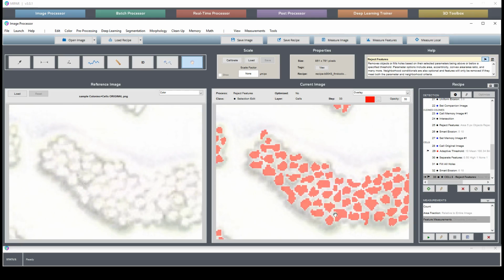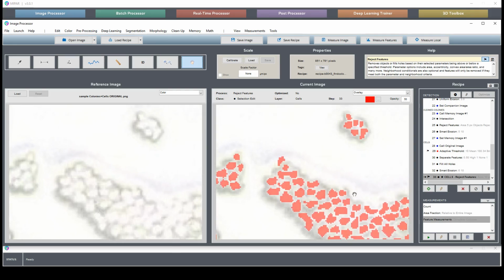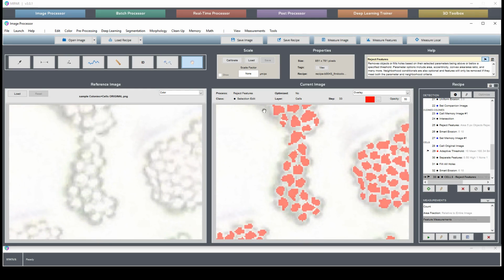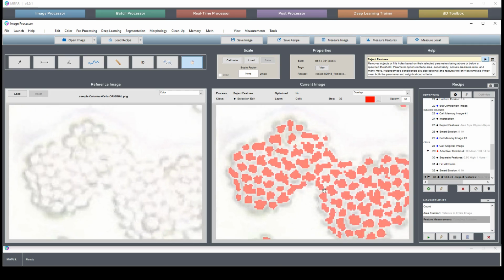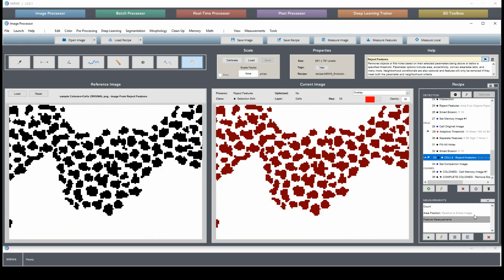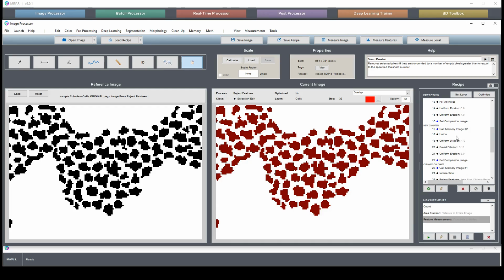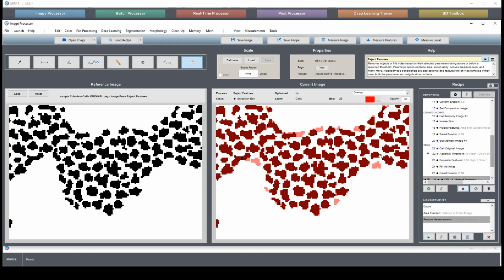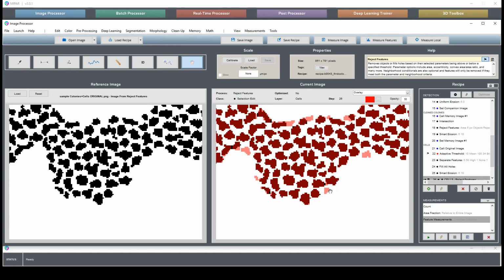Yep, the same should be true up here. One error there still, but much better. I don't see nearly as much. And if we wanted to have a look to compare what the before and after looked like, let me set this as reference image. And now remove what we just added here, here to here. You can see all the pieces that were fixed.